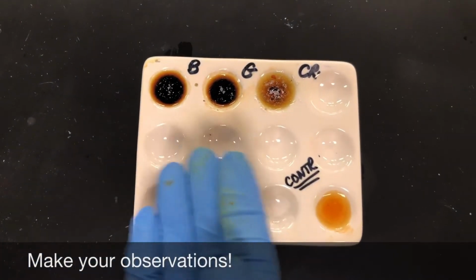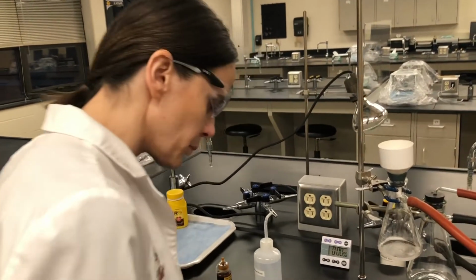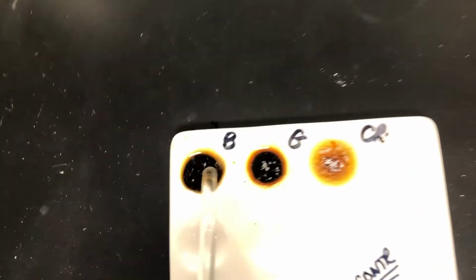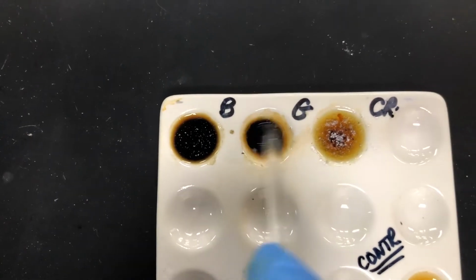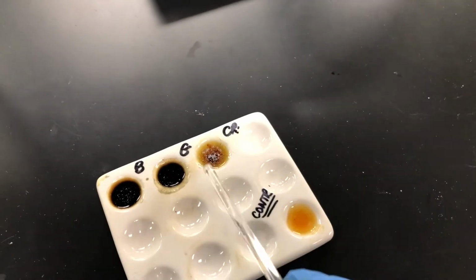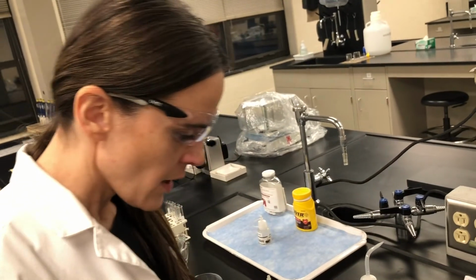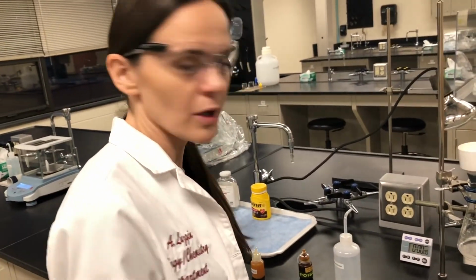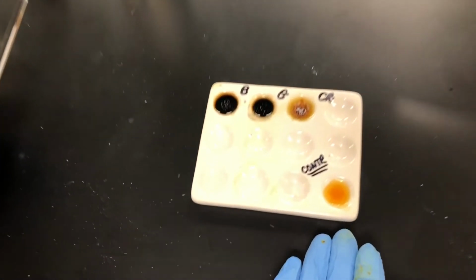As expected, my 2 commercial aspirins, the Bayer, which is the name brand, and the generic, have turned a blue-black, so it's mostly black in color. The reason for that is because both contain starch. You can see that deep black color. My crude aspirin did not turn blue-black, as it does not contain any starch. And how can we tell? It's always nice to compare the colors. Whenever you do a color test, you compare to the control, and my control is only a light orange color.